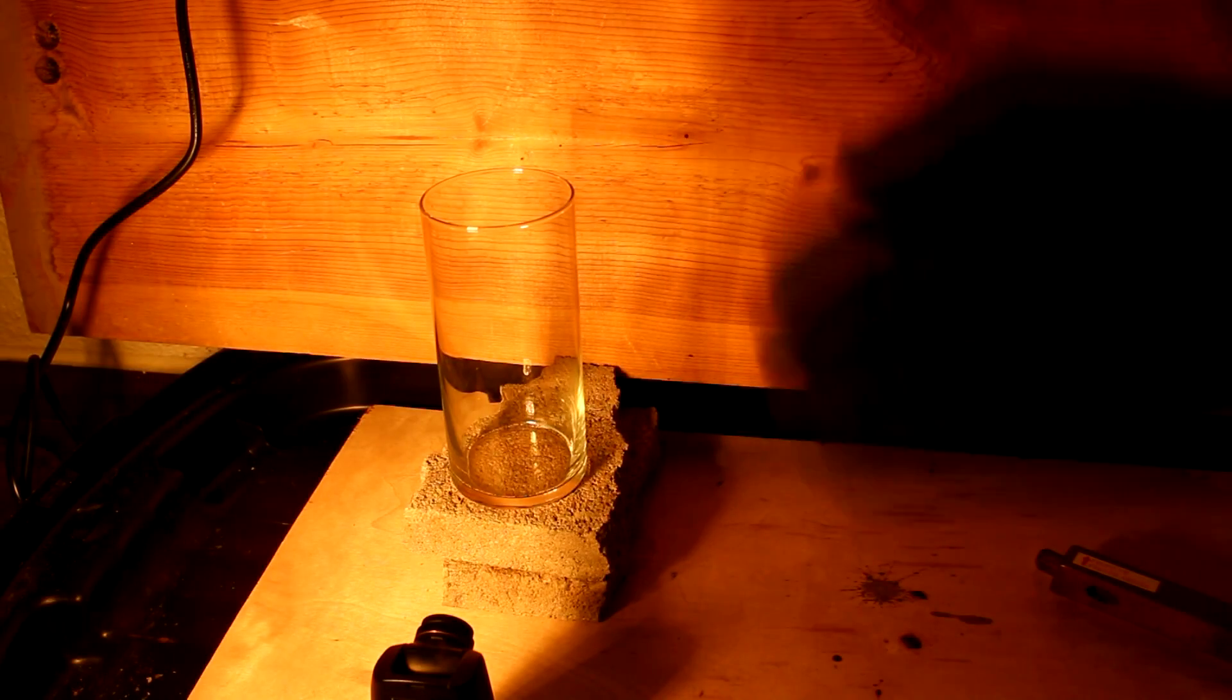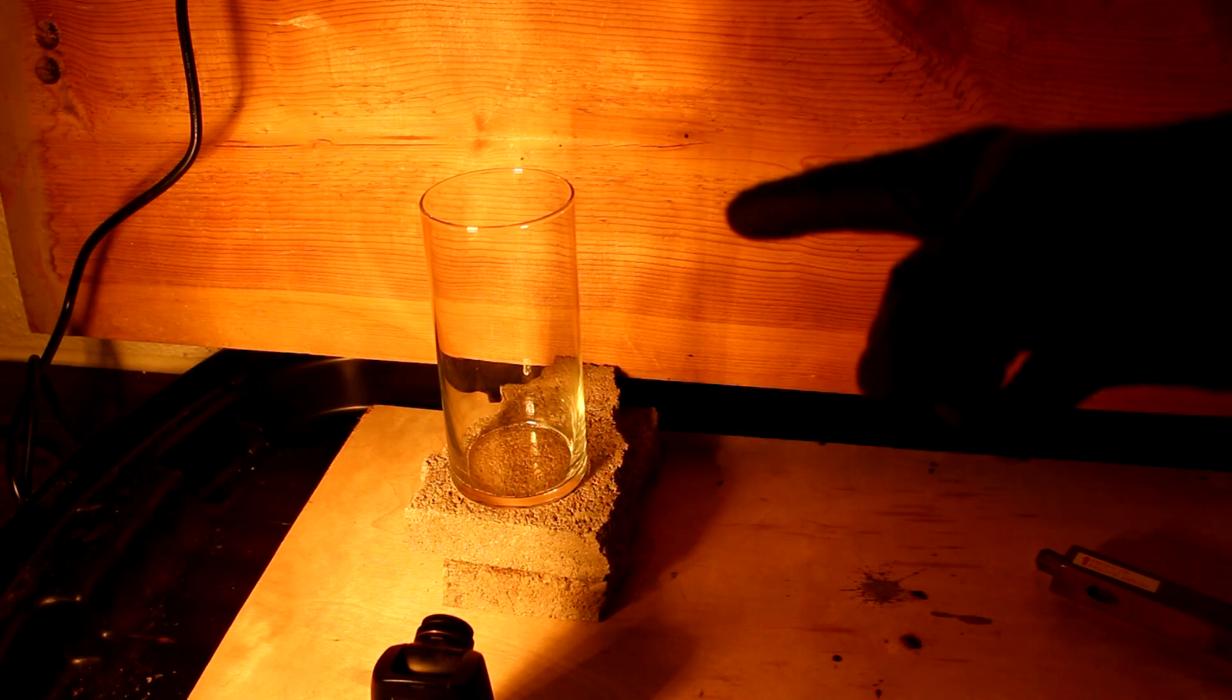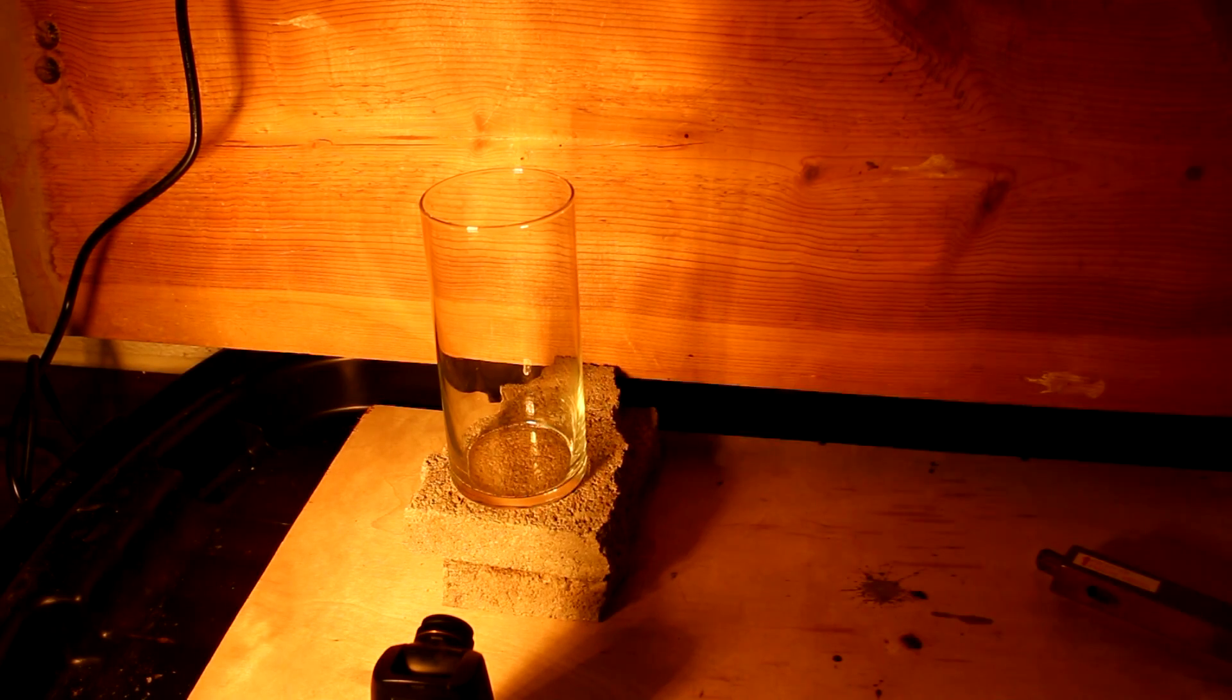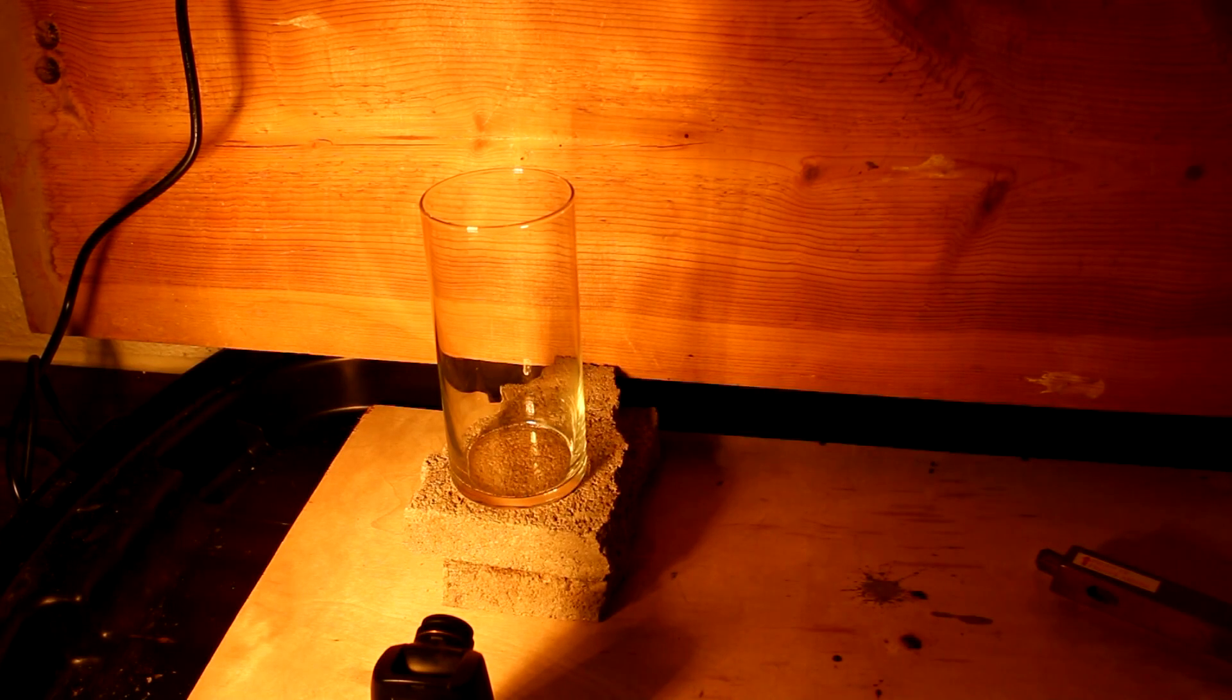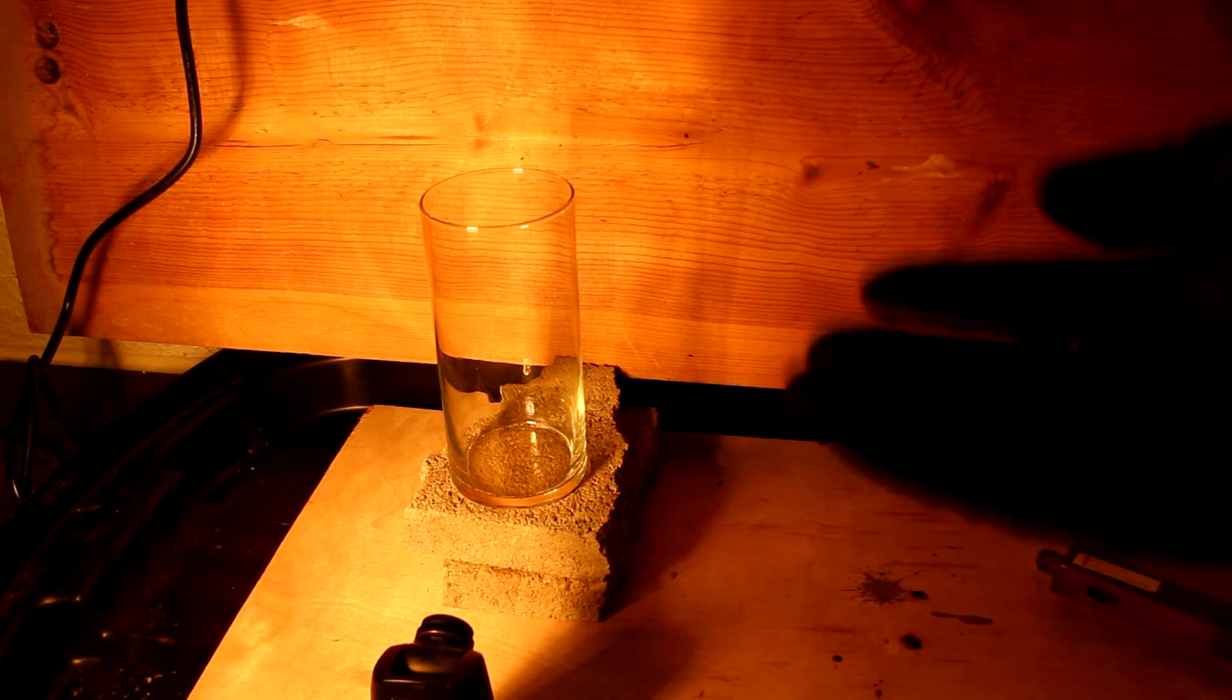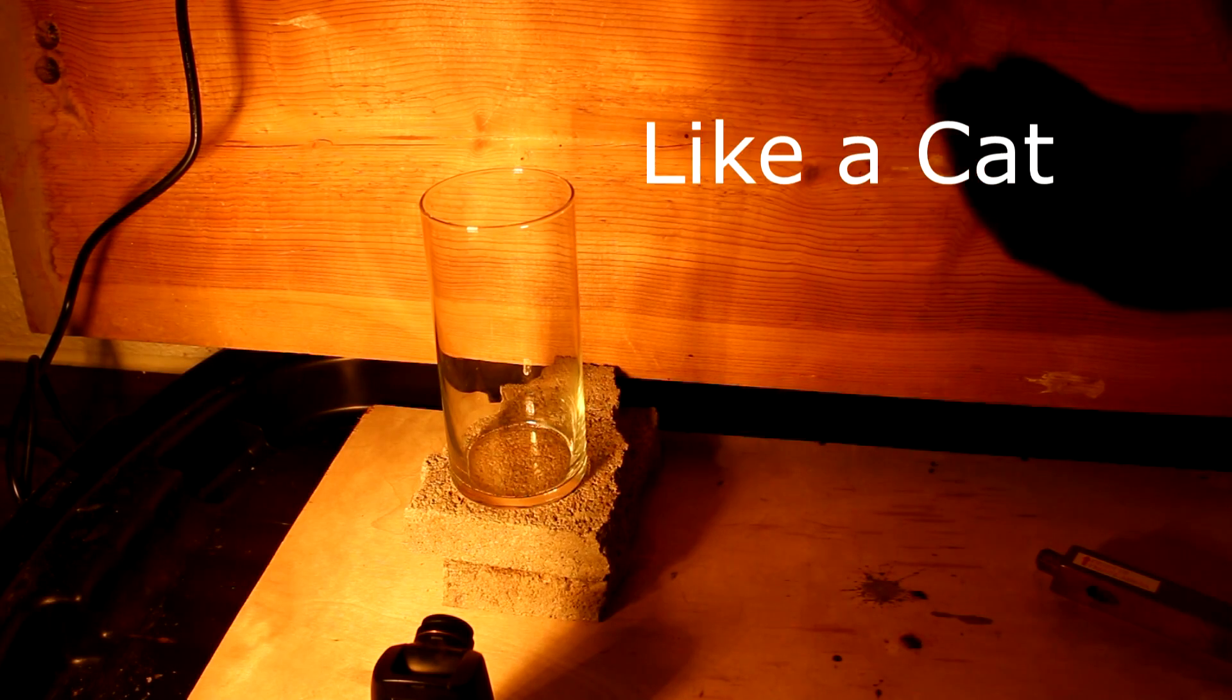So here is where I'm set up to perform the reaction. You can see I'm using a glass beaker sitting on some blocks and this is just because I wanted to film this with my time-lapse camera. Normally I would do the reaction just inside of the jug. You may have also noticed because of the echo that I'm doing this inside of the underground room which doesn't get very much traffic. I don't want someone to come and knock this over accidentally.